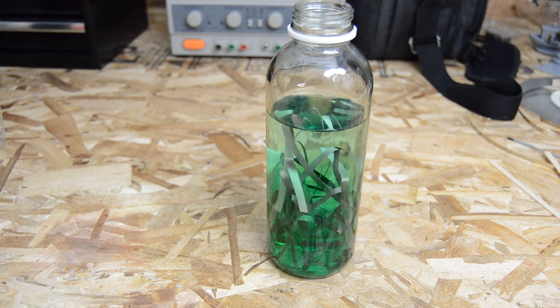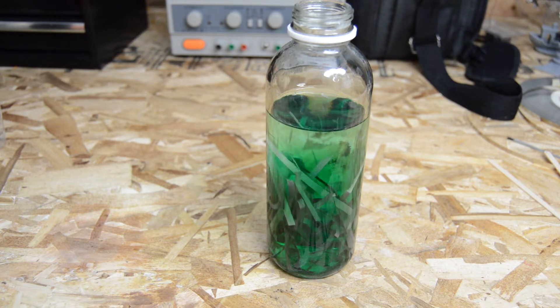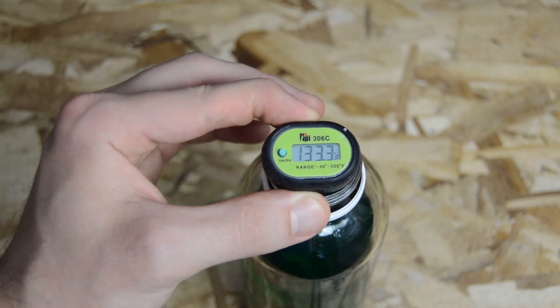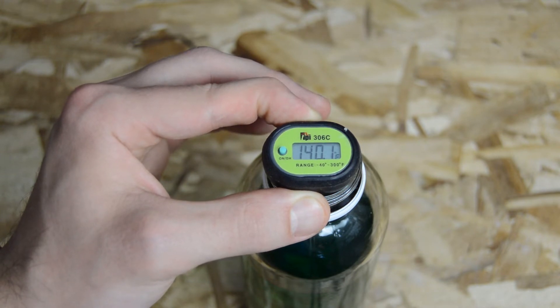The reaction will take a few minutes to get going, likely because of the oxidation that has to occur first. Once the reaction starts picking up momentum, the solution will start to get hot, which is good because the heat will increase the rate of the reaction. Just be a little cautious because it will get to over 140 degrees Fahrenheit. So make sure your container is in a place where it won't get disturbed and won't be at risk of being spilled.